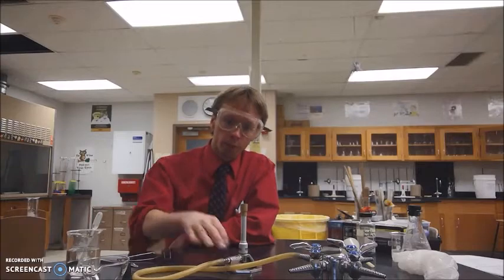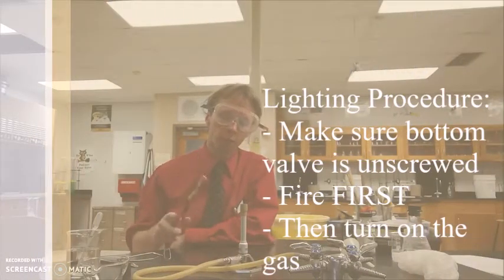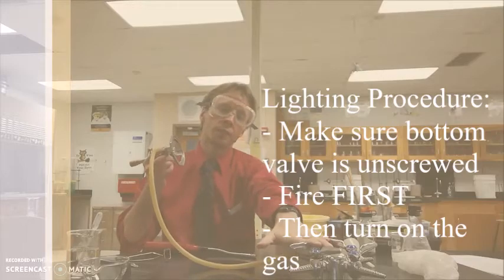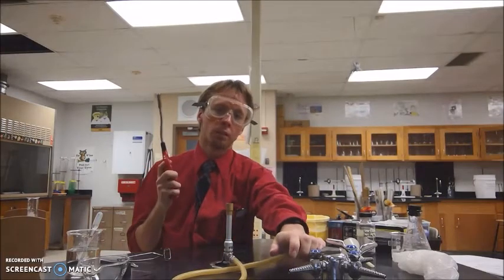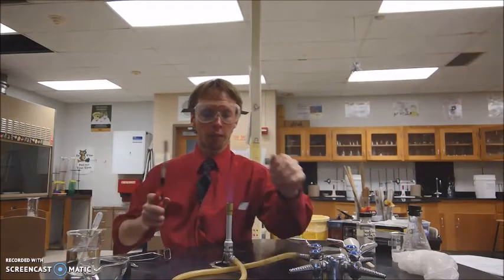You're going to light your Bunsen burner using the standard procedure where you're going to start your fire first before you turn the gas on. And you're also going to make sure that the bottom of your Bunsen burner is unscrewed a little bit so that the gas can come from the laboratory station gas line into your Bunsen burner. So I'm going to do my lighting procedure, and also I'm going to secure my tie as well. So go ahead and light your fire, and then get your Bunsen burner to turn on.